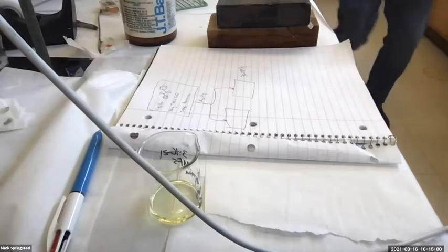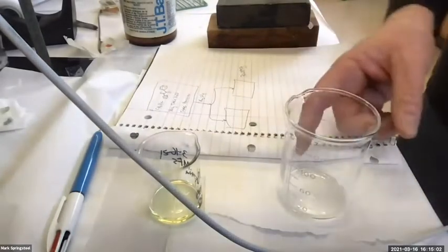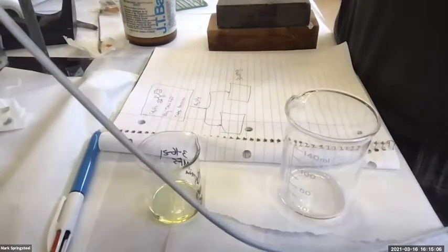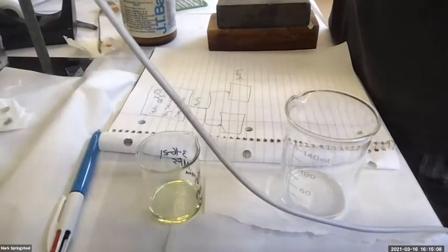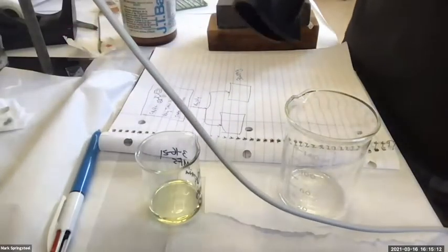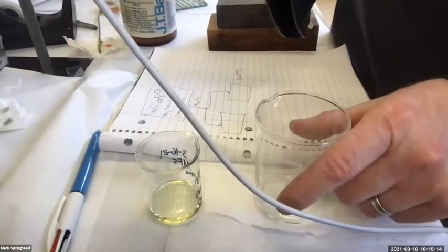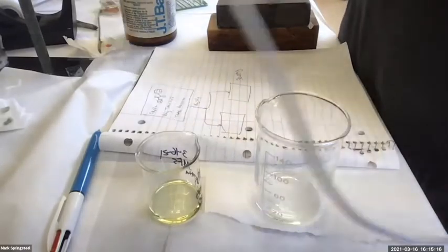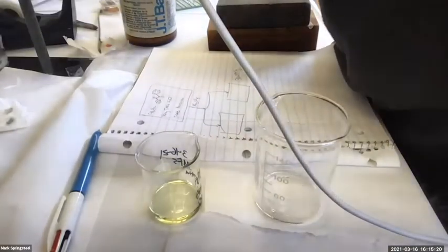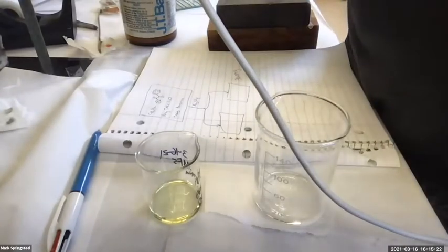And then while that's in the warm tap water bath, I could hit it with the Conair 1875. You know, our Conair, the highly technical blow dryer here. I could be blow drying it to try to speed things up, but then I have to sit there and hold the blow dryer. And I don't feel like doing that. So instead, I'll just set it in the fume hood and let it evaporate on its own.